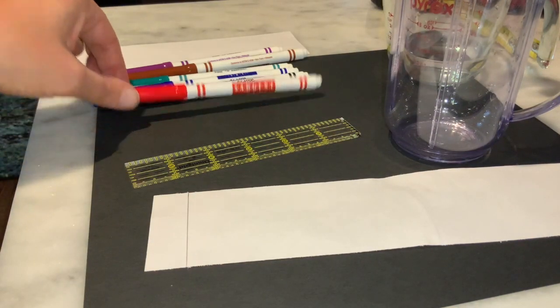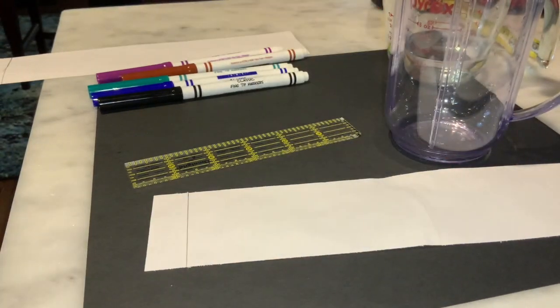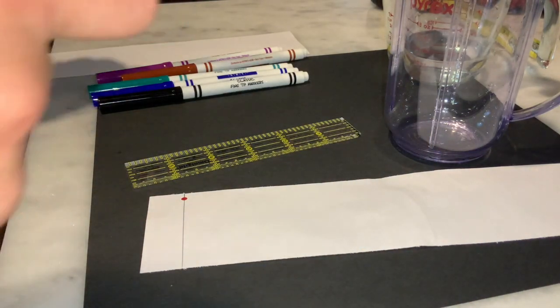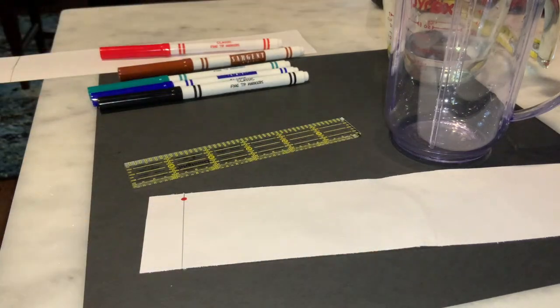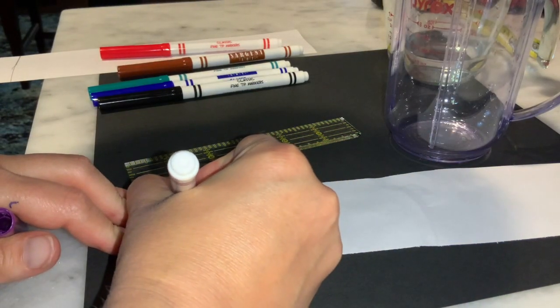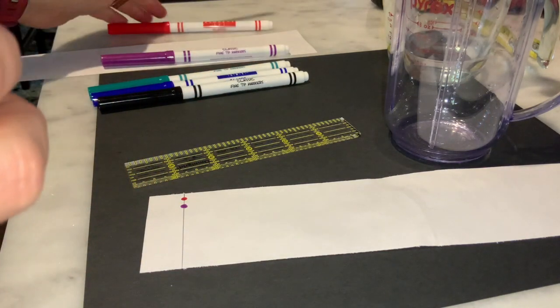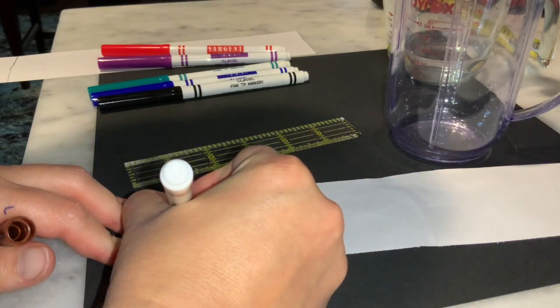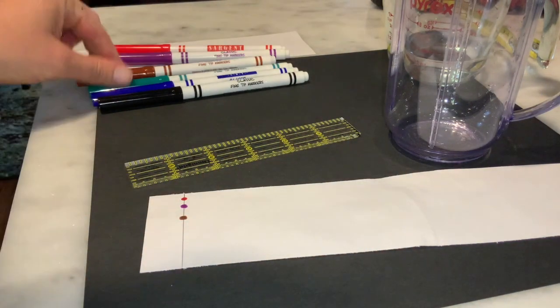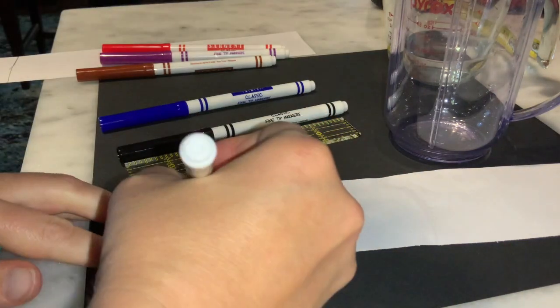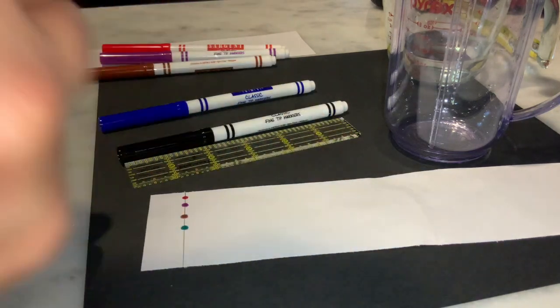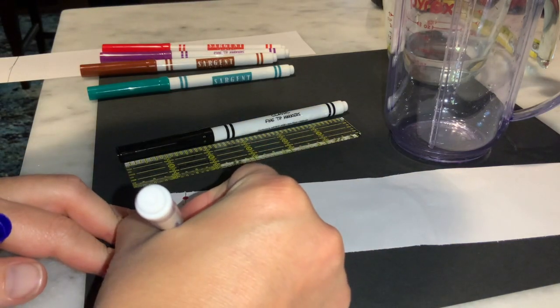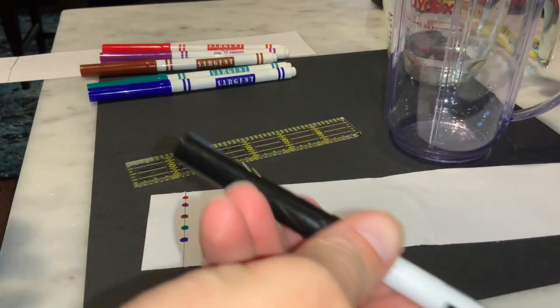So I'm going to take my ink pens. I'm going to start with red and then I have my purple, got brown, next is green, blue, and then finally black.